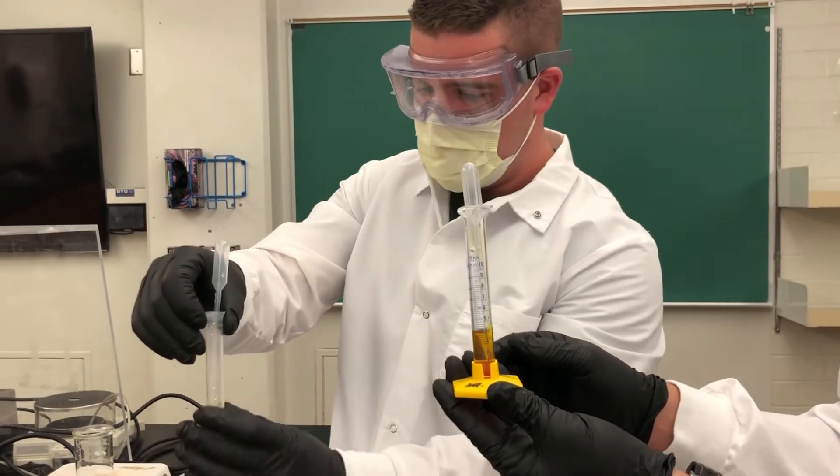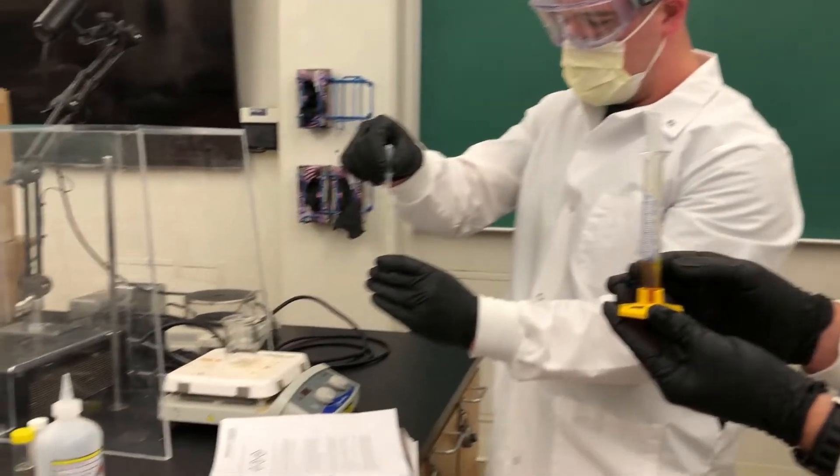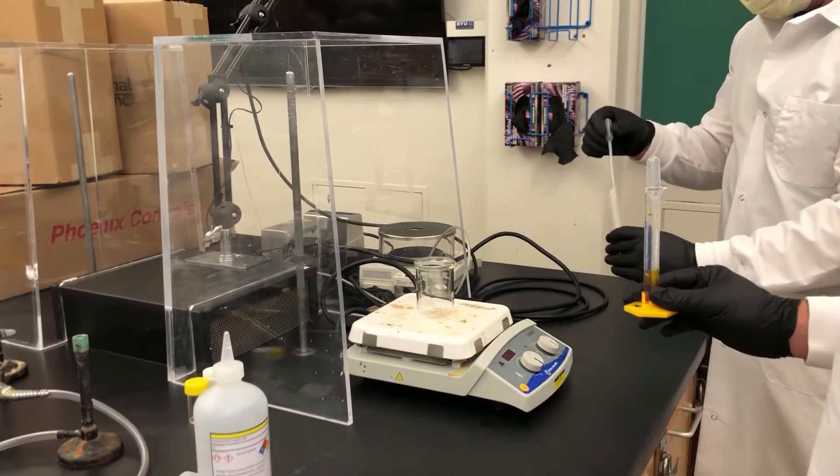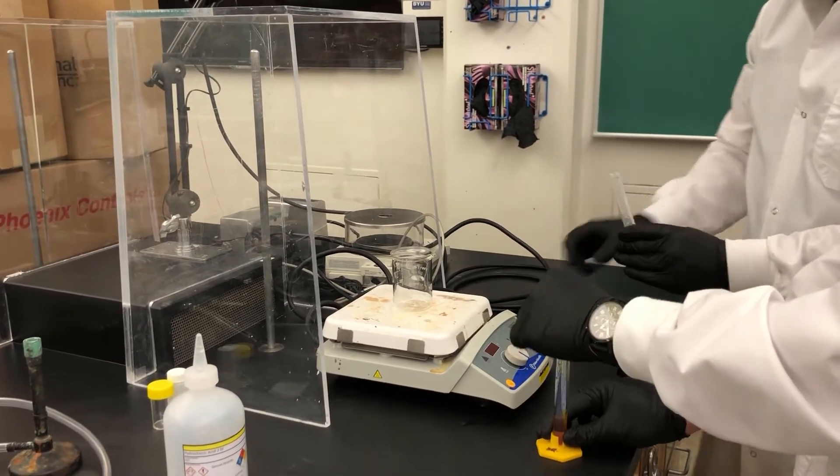Now that both solutions are prepared, we can pour them into our beaker, which is going to be on our stir table here.